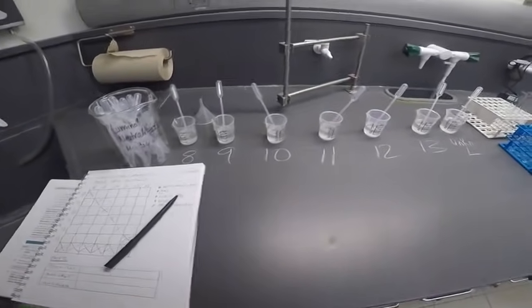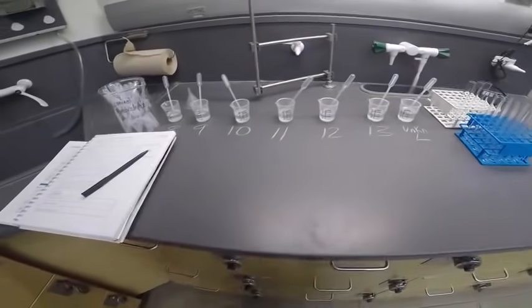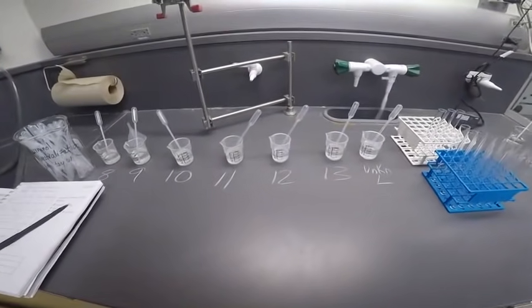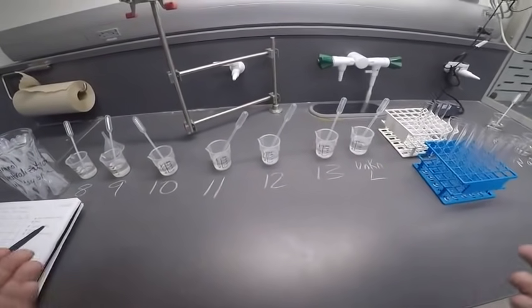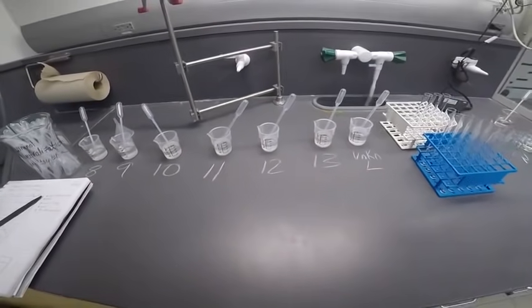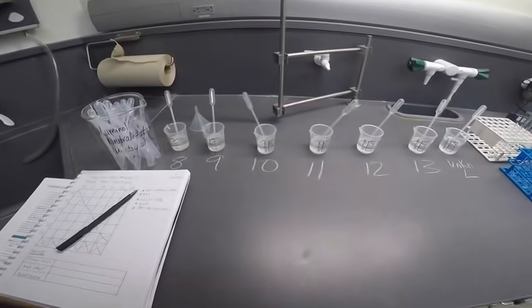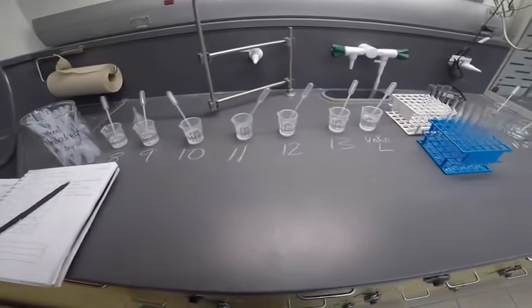And we're going to use some observations from some reactions to figure out what the identity of those solutions are. And we're just going to systematically react them with one another and see what happens. Now there are a couple of pieces of evidence that we're looking for to determine if a reaction occurred. The first is the formation of a precipitate. So all of these will be some sort of double displacement reaction that might be followed by decomposition.